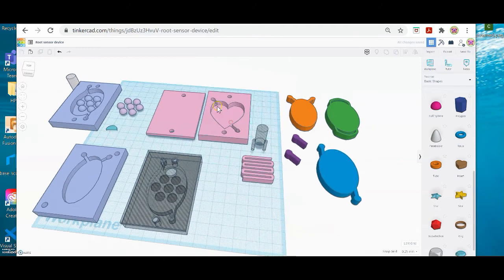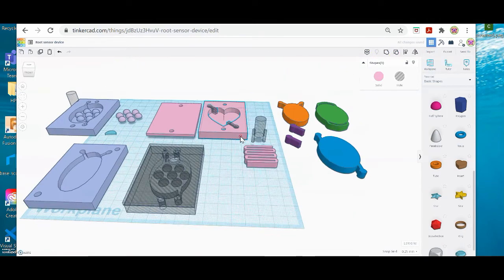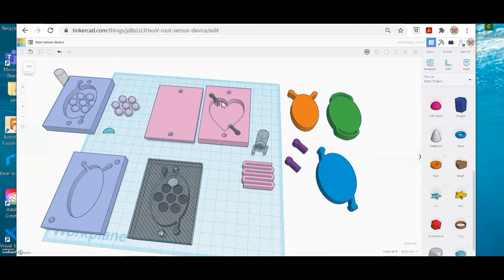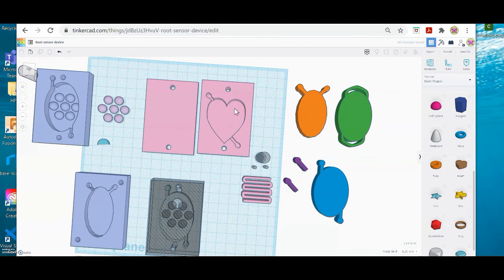Now when I go sideways, I can see my little ports are not quite the height I want, so I'm going to go back up here and go to Ungroup. I'm going to go sideways, unclick, and then select the ports again, and just move them ever so slightly down till I think that they are flush. Draw my selection box again so I have all the objects here selected, and go back up to group, and that looks good to me. Alright, so let's say that I am done with my base plate.